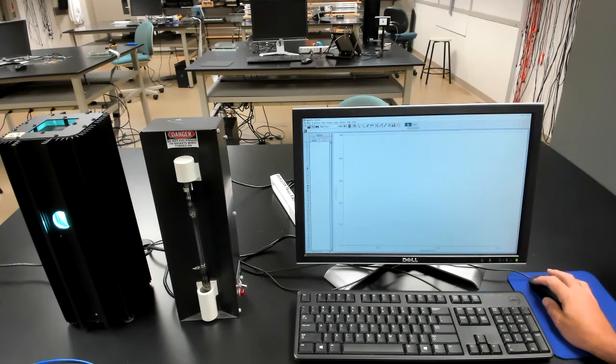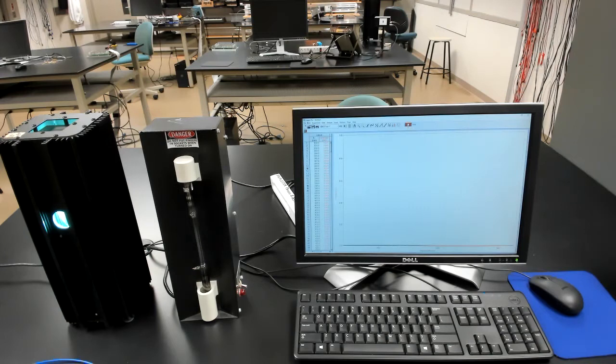Now if we enable collect here, it will start collecting data. Let's start by holding up the probe to the room lights. There we are. What you're looking at now is the spectrum of the room lights. Looks kind of funny, doesn't it? There's a sharp peak at around 400 nanometers or 380 nanometers. That's deep in the violet. And then there's a very broad peak centered in the visible spectrum, okay?